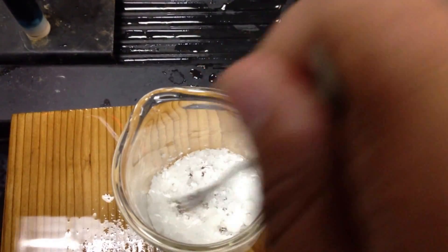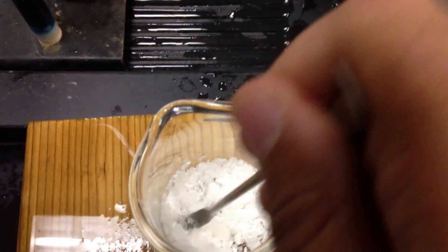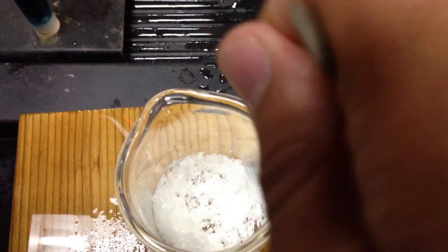What's happening, party people. Get a little closer there. Miss B. What do you see? Anything changing? Looks like a lot flakier. A lot flakier? I'll tell you this. It smells like ammonia.